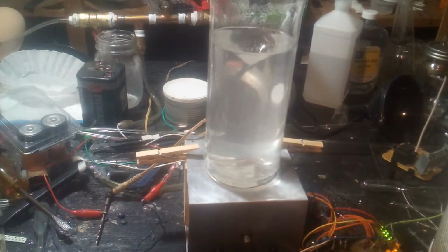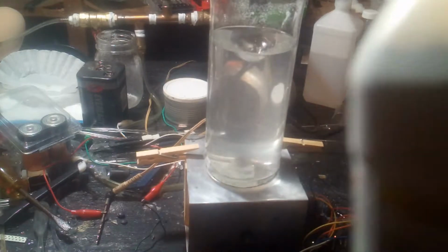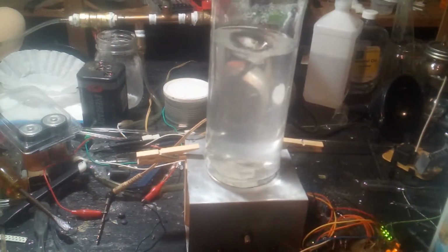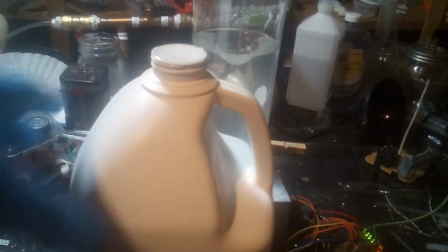And now that the majority of the borax is in solution, it's time to convert it to boric acid. Conveniently, if you have the sodium salt of an acid you want, and you happen to have a stronger acid around, you just mix the two together, and the weaker acid comes off. So, a stronger acid would be this muriatic acid. If I can get the bottle open. This, folks, is what we call adult-proof packaging.